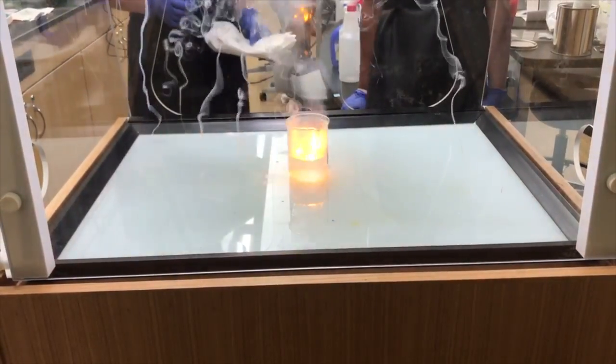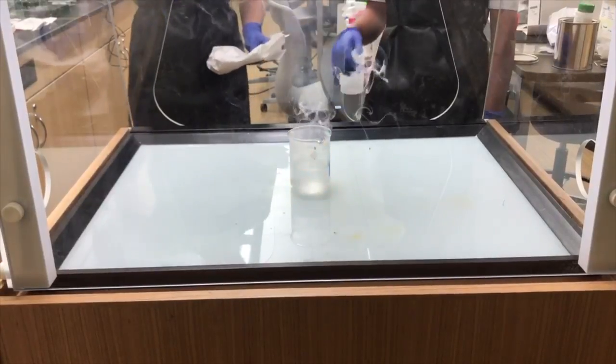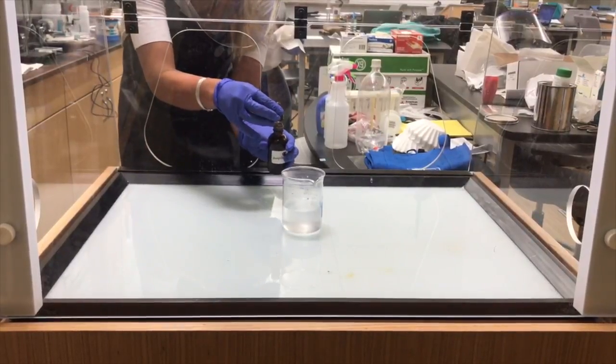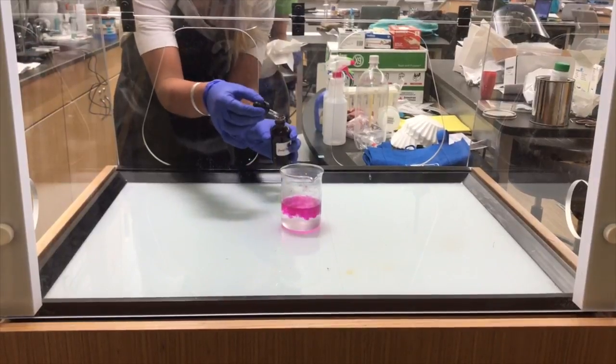We used the phenolphthalein indicator to show that sodium hydroxide was produced in the reaction. The indicator turns pinkish red when in contact with sodium hydroxide. Since sodium is an alkali metal in its natural state, every piece has slight variations in its chemical properties, resulting in variations of the reaction.